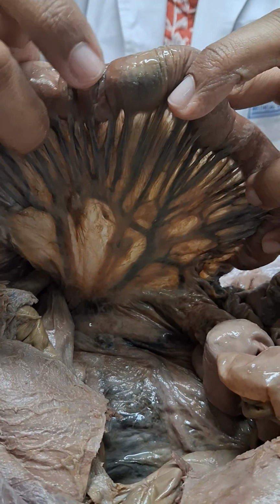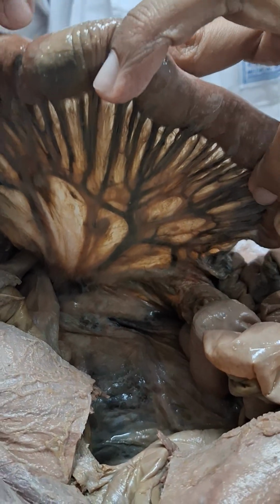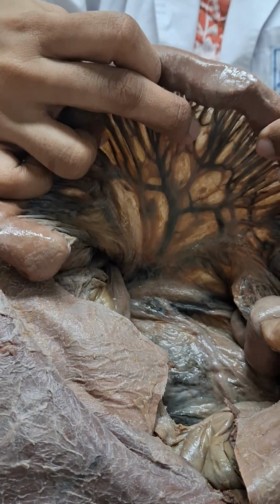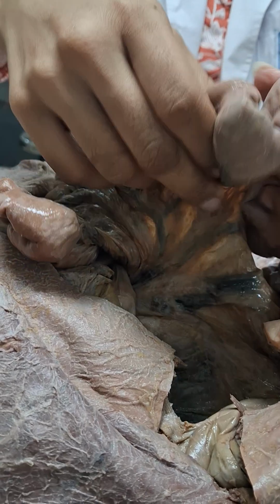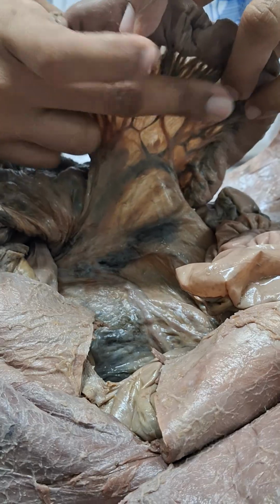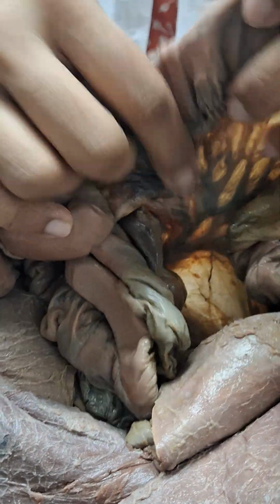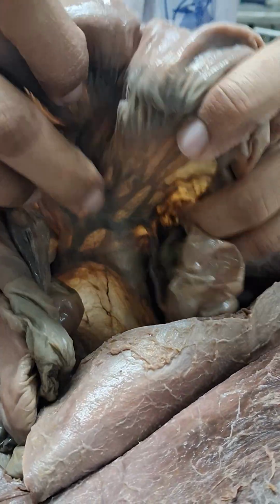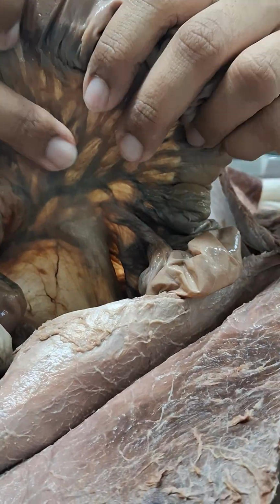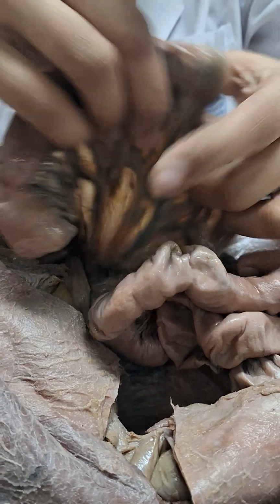So here you see that there are longer vasa recti, but fewer rows of the arterial arcades themselves. Like here you see a singular row. Here you can see them becoming one row, two rows. Move on further, you can see a couple more rows. You have one row here, another row here. So they will progressively increase until you get to the ileum, where it appears as a spider web sort of structure with multiple rows, but the vasa recti do appear shorter than they did back in the jejunum, where it is very, very long.